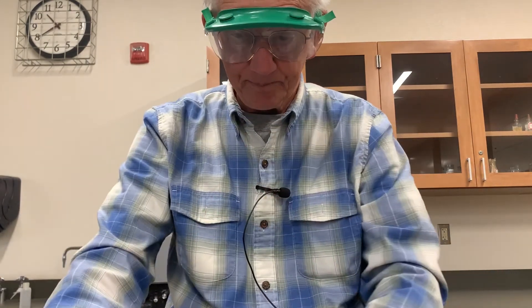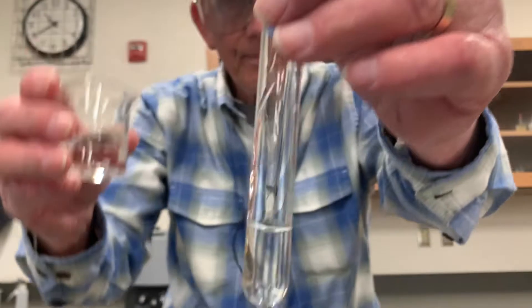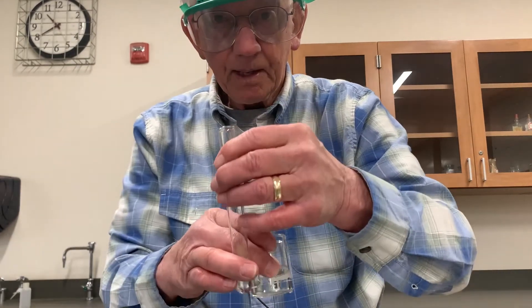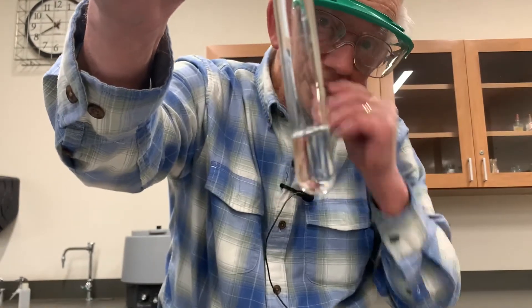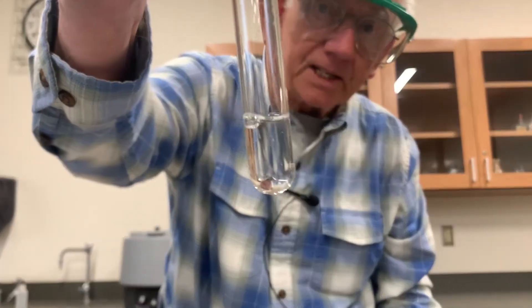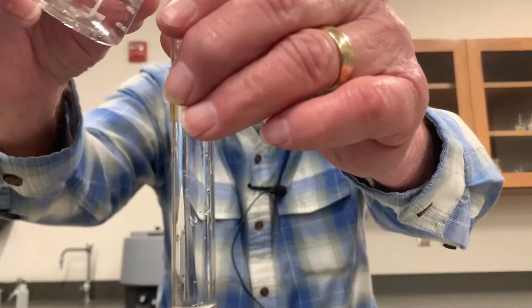I'm bringing over a fresh set, and we're going to test these with sulfate. Once again: magnesium, calcium, strontium, barium. Magnesium with sulfate, then calcium with sulfate. If you go online, you're going to find that they tell you that calcium sulfate isn't very soluble, yet you don't see much forming here. I'm going to let it sit a minute. That was calcium with sulfate. Here's strontium with sulfate.